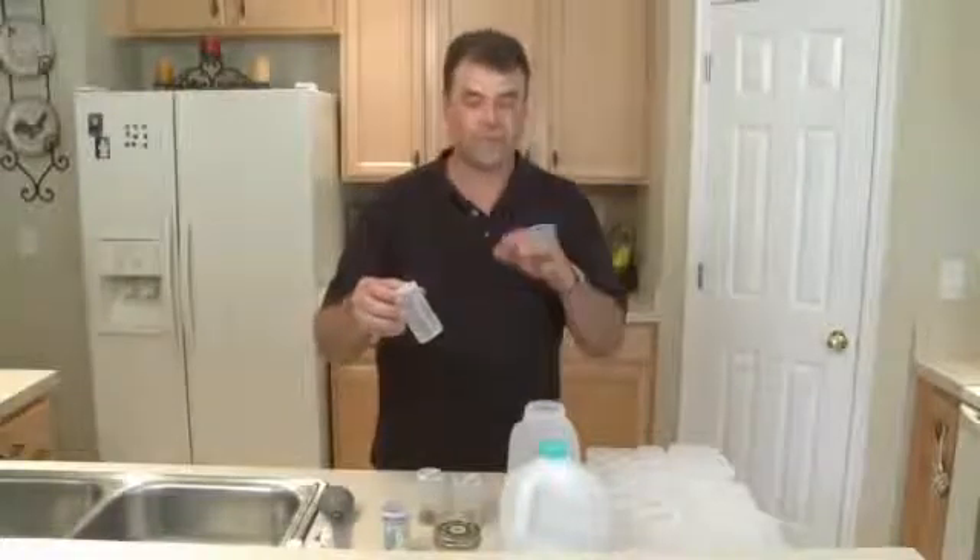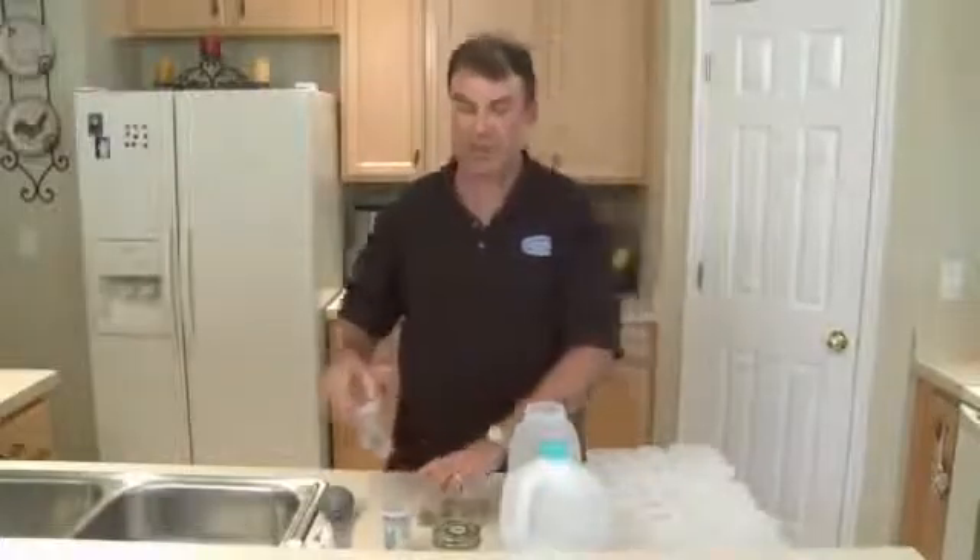I am going to put these out of the way and we are going to take the ingredients from the kit and I am going to show you how to mix those together and make your own tissue culture gel.